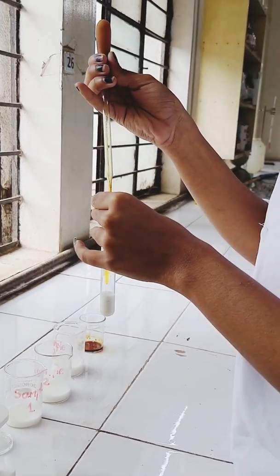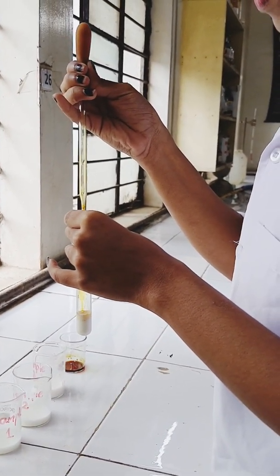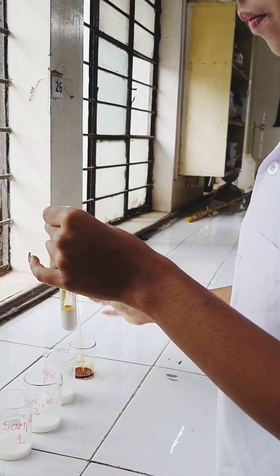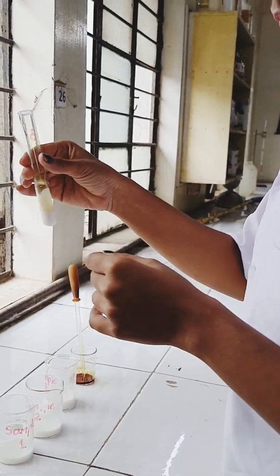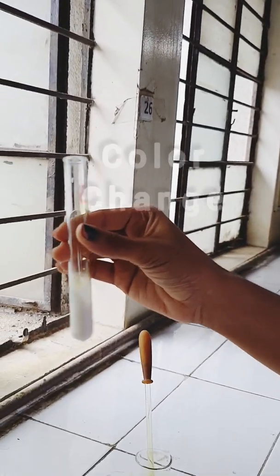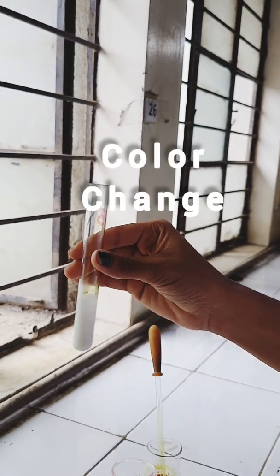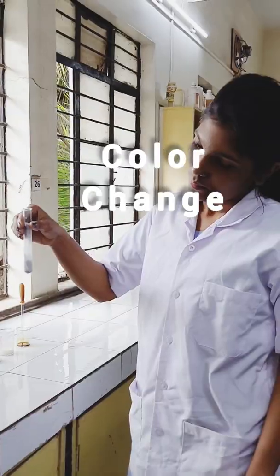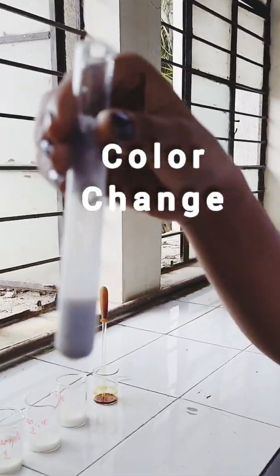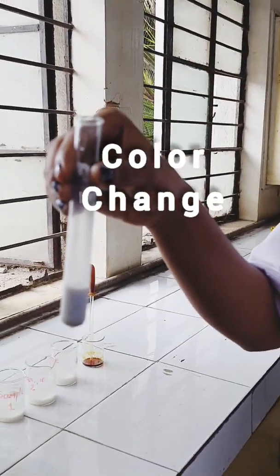Now, the third test tube. Add iodine drops, mix it well and observe the color. Here, this sample shows a blackish color, which means this sample is also adulterated with starch.